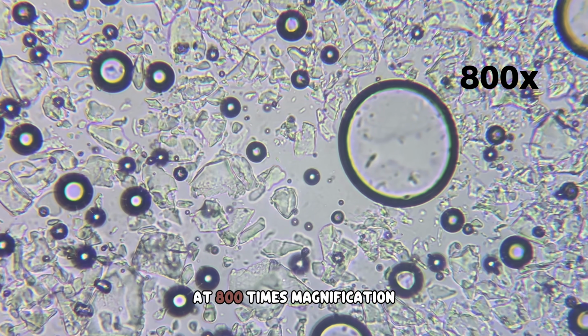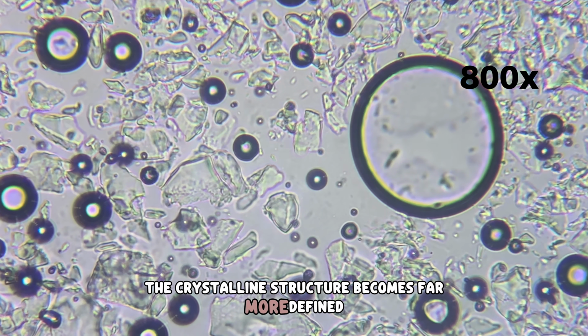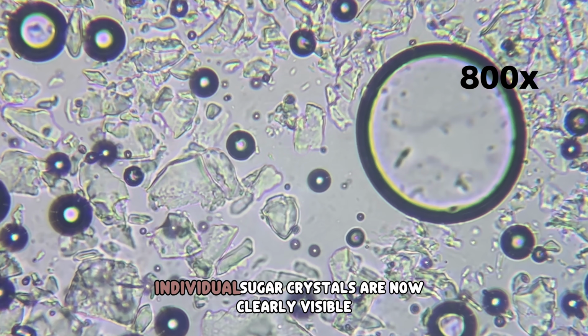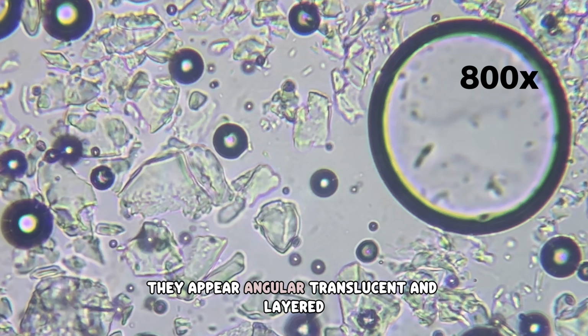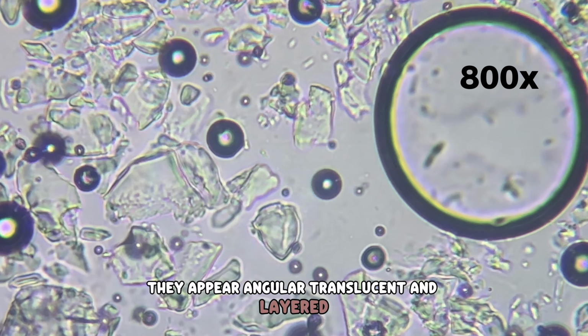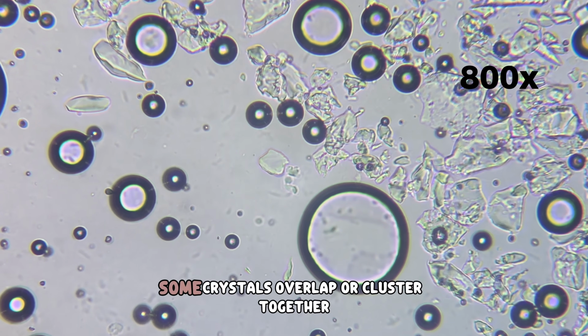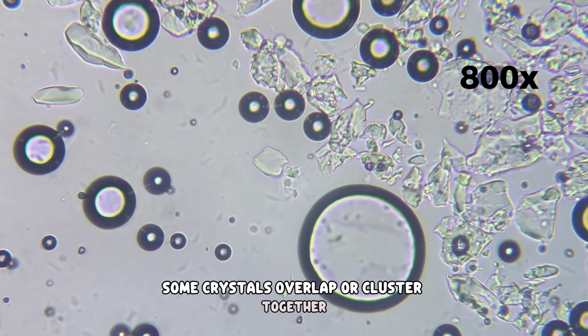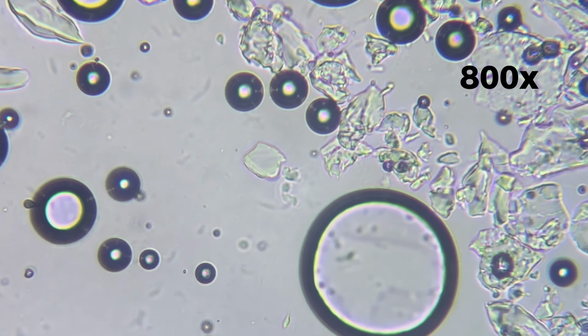At 800 times magnification, the crystalline structure becomes far more defined. Individual sugar crystals are now clearly visible. They appear angular, translucent, and layered, reflecting light differently along their edges. Some crystals overlap or cluster together, forming compact regions of solid structure.